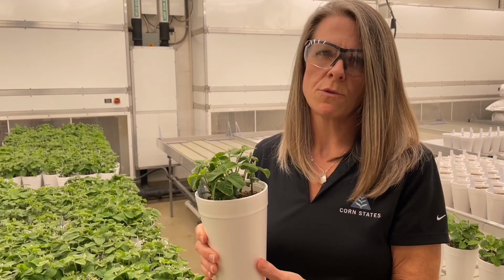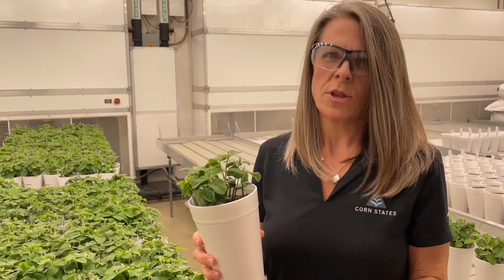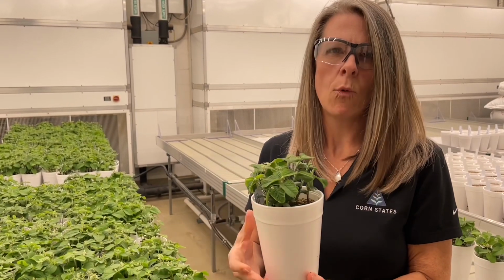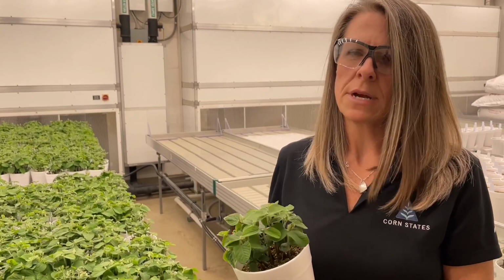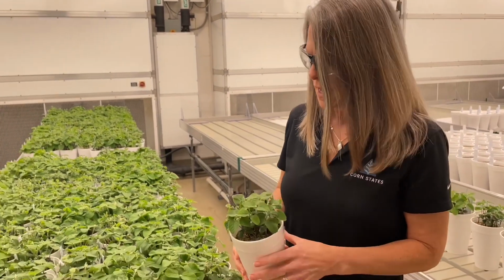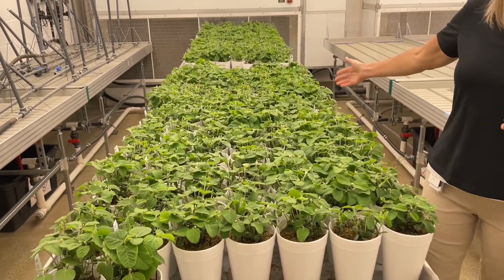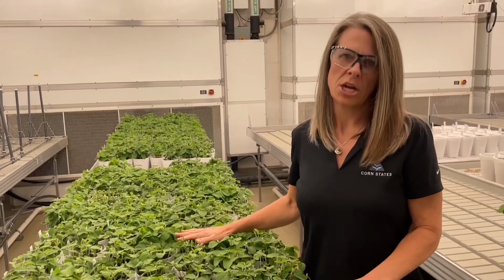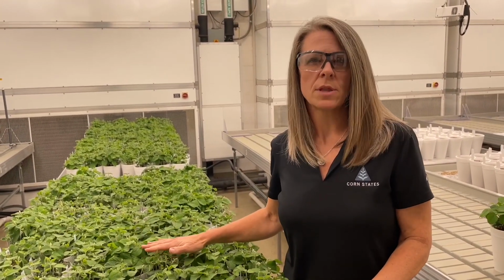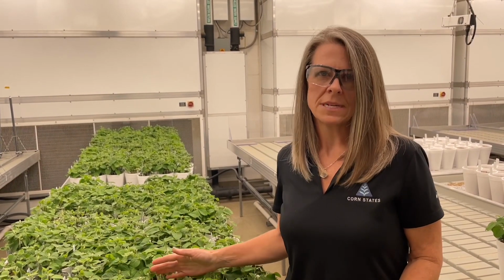So as our plants grow and our roots establish, they're going to be forced down into that pathogen with no escape, and they're going to have to see how well they can tolerate that pathogen. So this assay only runs about 3.5 weeks, but it's very effective. And as you can see, with each of our tests, we have a set number of varieties that we do, but we always include known checks. This helps us to determine the quality of our assay, make sure that our pathogen is viable and as virulent as we want it, and that we can get consistent results from test to test.